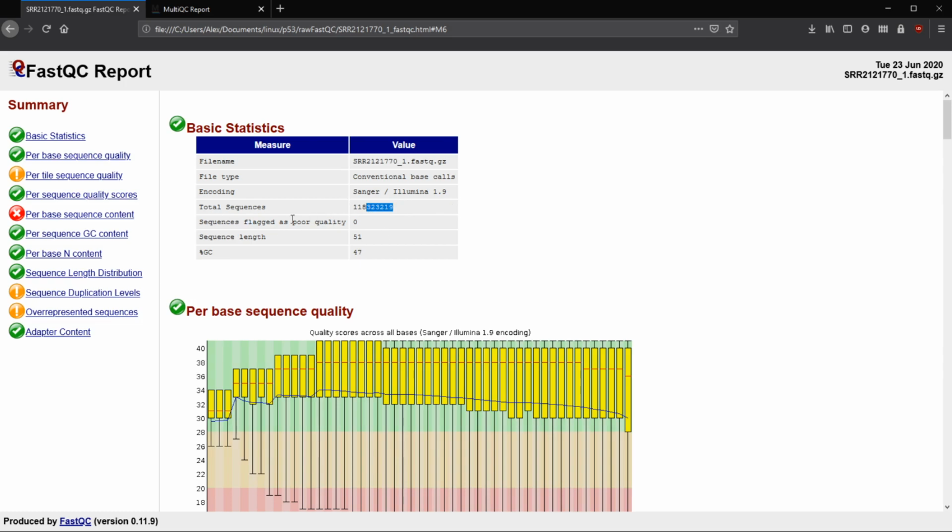118,323,219. Sequences flagged for poor quality. I'm not 100% sure what is considered poor quality here, but we have 0. For RNA-seq, I've seen some people go down to what's called a Q score, which we can see here, of like 20 when they are looking to trim. For genome sequencing, when I did genome sequencing, we actually wanted it a little bit higher, so we want all of our reads to have really high quality. It was set at 25 when I did it. Sometimes people go 27 or even 30. So if the sequence quality is below 30, it just gets thrown away because there's not as much confidence in it.